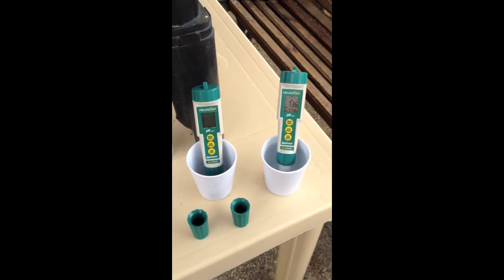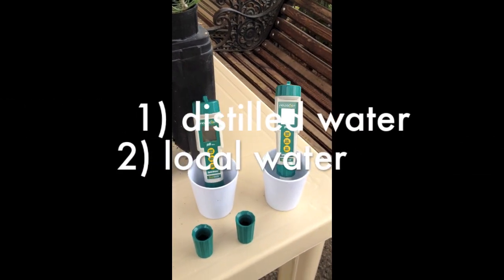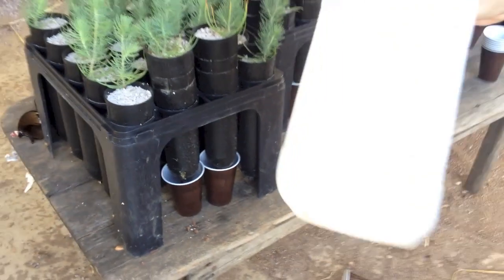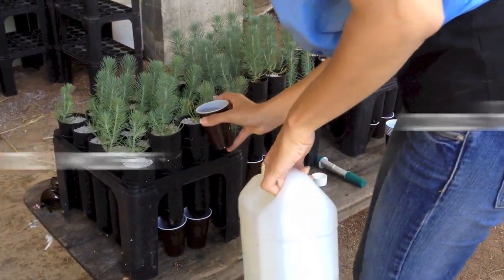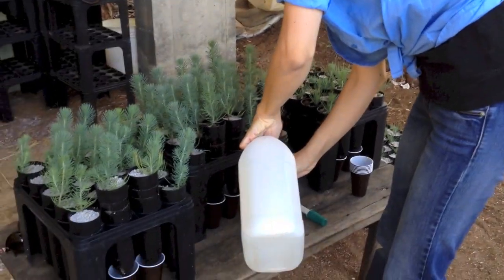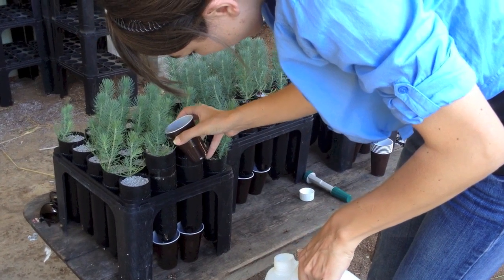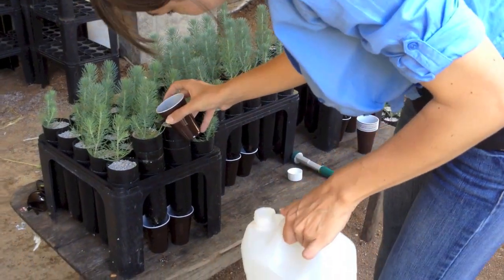Next, take baseline readings of both the distilled water that you have provided and the local water source that you use to irrigate your seedlings. Then, place cups or beakers beneath the containers that you will be measuring. These vessels should have enough room to hold at least 50 milliliters of leachate. Begin to pour only distilled water through the selected containers, using a consistent amount between all containers being measured. When you see that the leachate has accumulated in the cups below the containers, start a timer. Wait at least 15 minutes before your measurements begin.